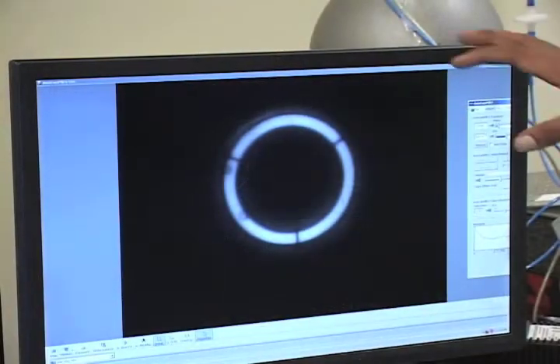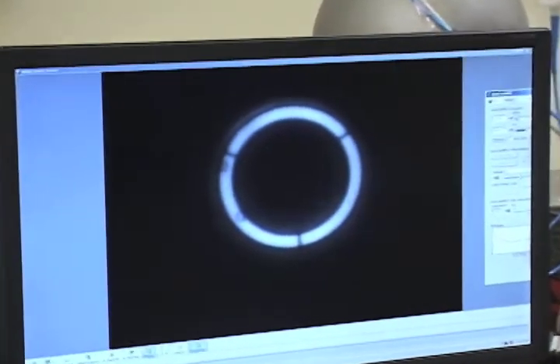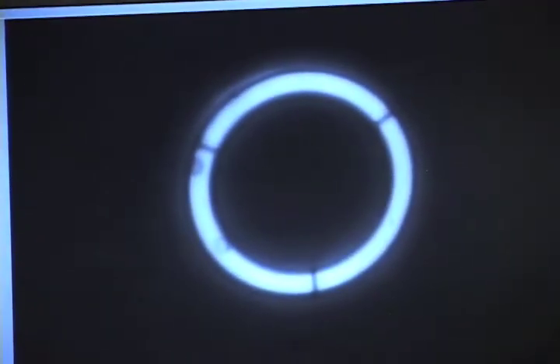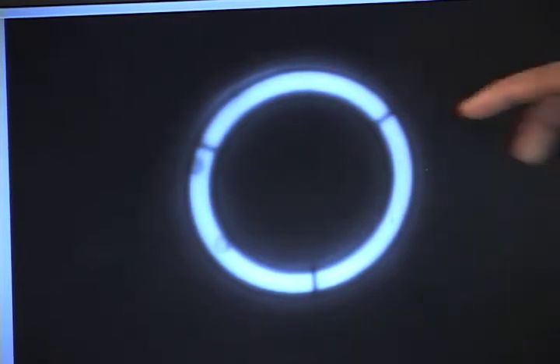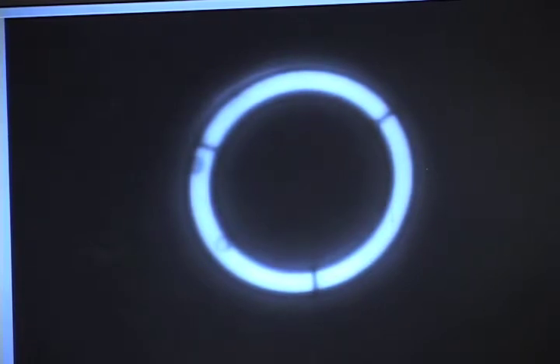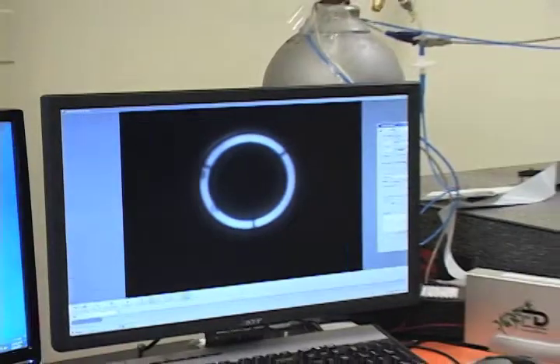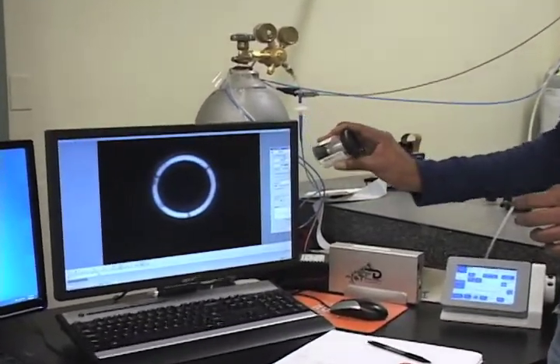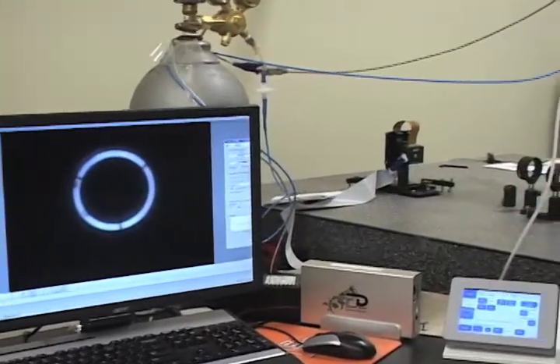So now on the camera we can see this. We're basically visualizing the ring that is projected onto the liquid crystal phase modulator, and as you can see, it looks identical to the phase contrast ring, because that is what we're seeing. We're seeing the back focal plane of the objective, which is the frequency domain, the Fourier transform of the image. And this is the same thing you would see if you grabbed a regular microscope objective and peered down one end: you'll see this same phase contrast ring.